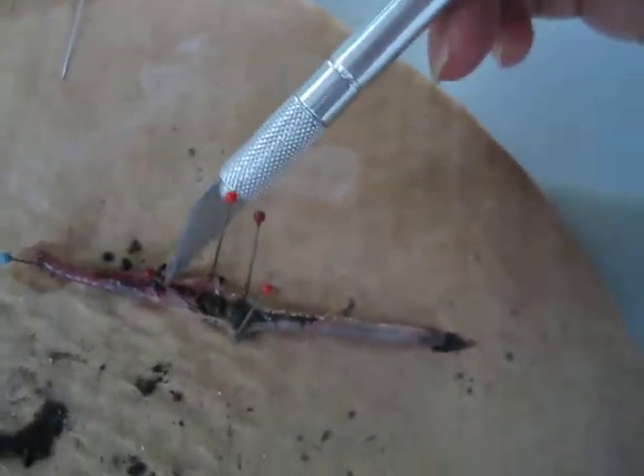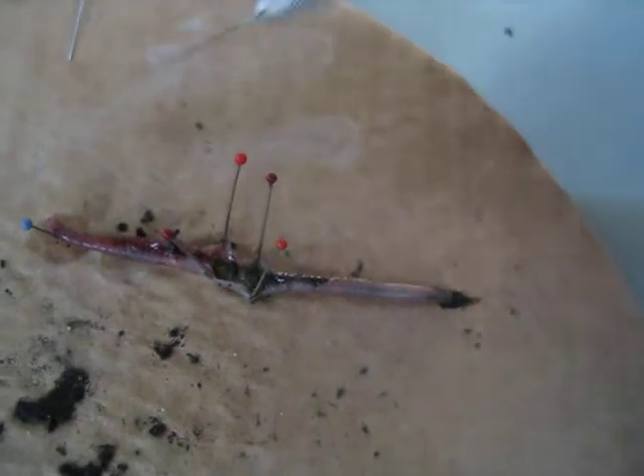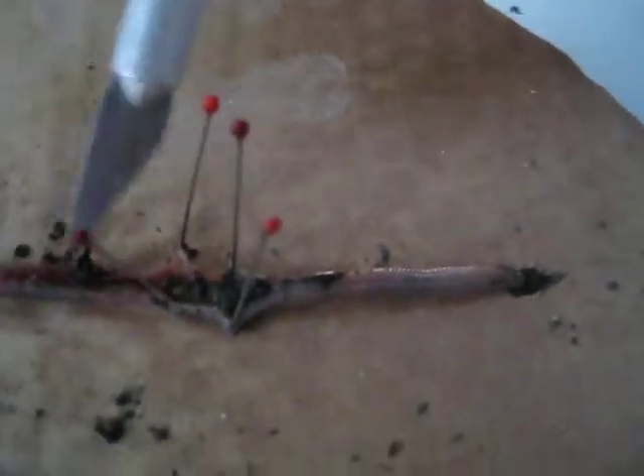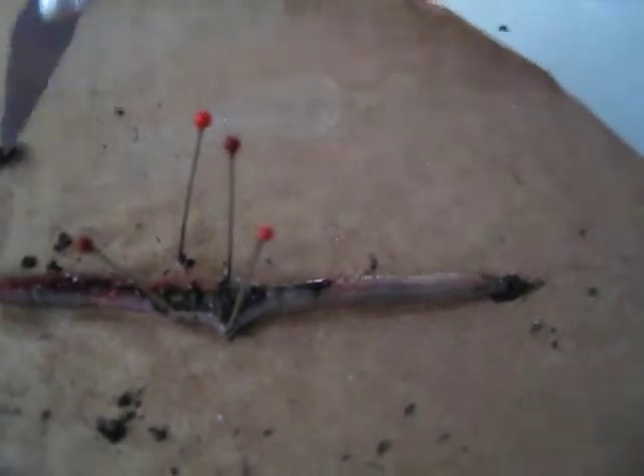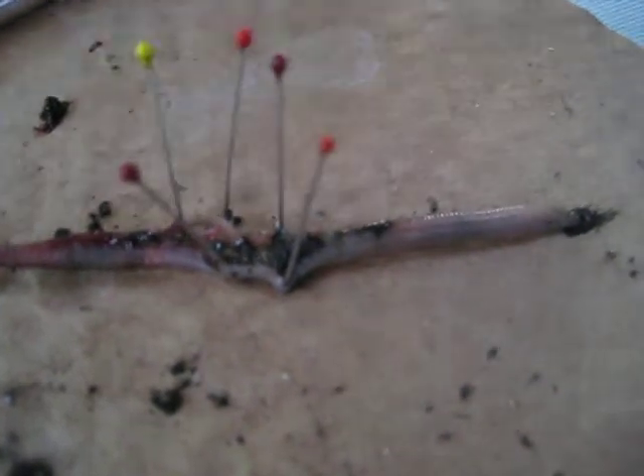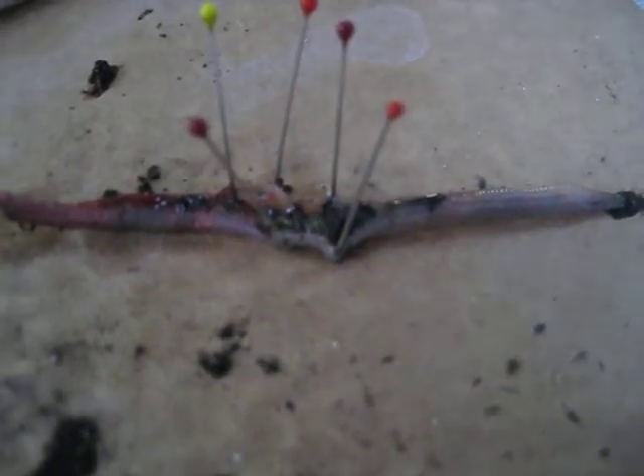I think it's part of the gut tube. Oh, that is gross. As you can see, we're not gonna... we're not experts. The worms we've dissected before were a lot bigger and easier to maneuver. These were found in a compost pile. The digestive tract opened, which is all that brown guck spewing out. Earthworms eat stuff and poop — all this brown stuff is poop from when the earthworms are dying.